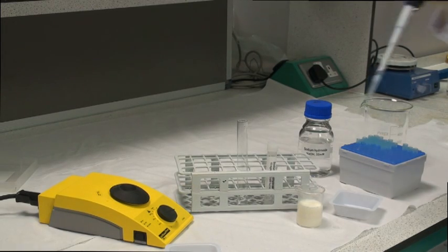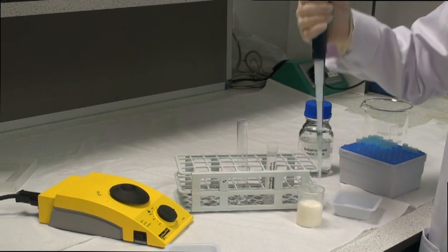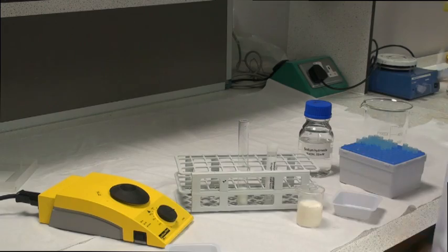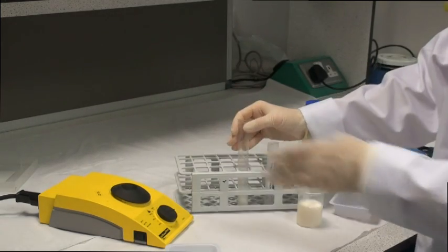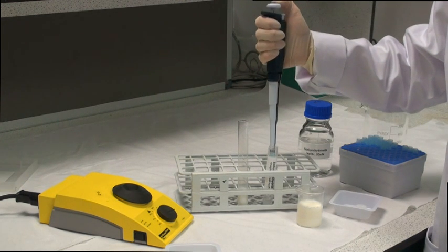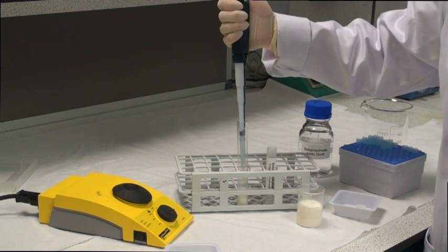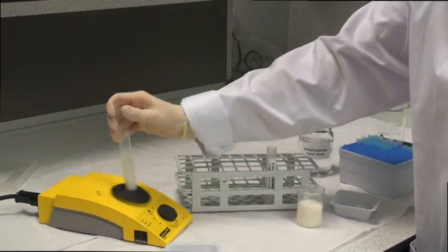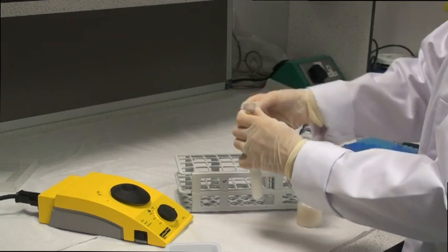Accurately transfer 1 mL of beta-galactosidase pretreated milk sample to 4 mL of water in an 18 by 150 mm glass test tube. Mix the contents of the tube thoroughly, then add 1 mL of sodium borohydride solution — sodium borohydride at 10 mg per mL in 50 mM sodium hydroxide. Stir the tube vigorously, seal with parafilm, then incubate at 40 degrees centigrade for 30 minutes.